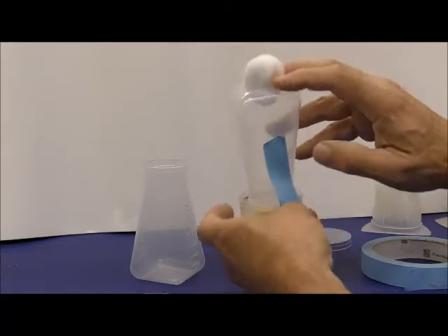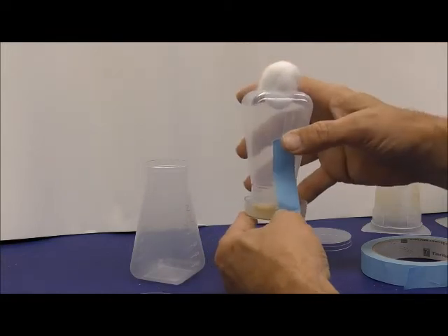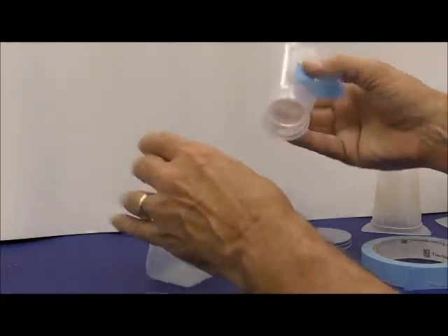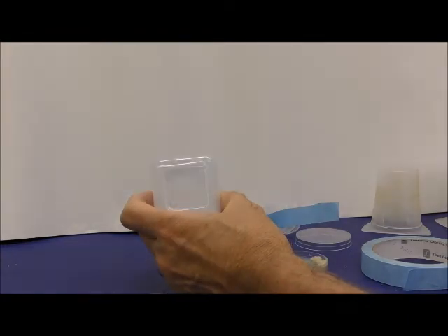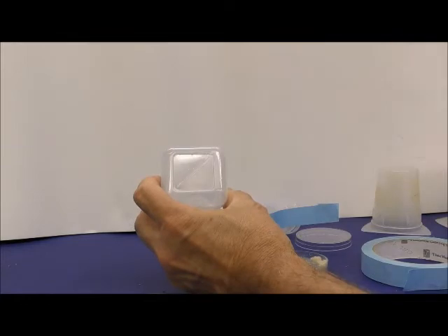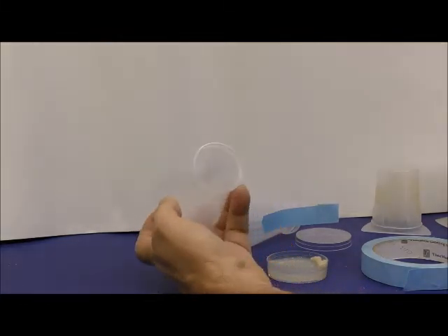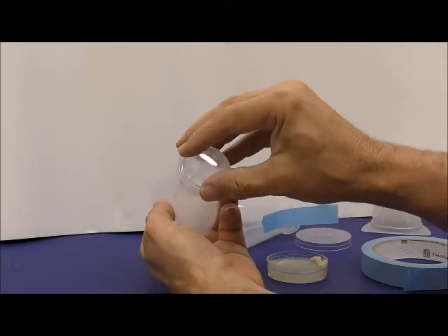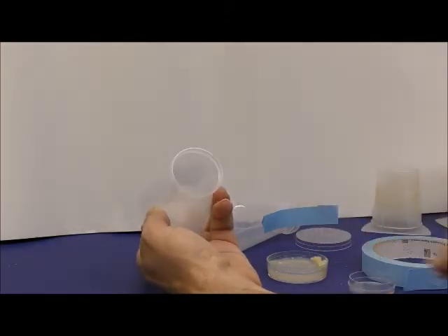The problem is it's pushing on the agar a little bit, and if you push down too hard, the agar will get stuck in there. You might think, oh, well, I'll make the dish on the top and put the cotton plug in here. The problem is many of the plastic bottles have this kind of weird deformation in the bottom, so it's hard to get a little dish on top of those. They do make these smaller Petri dishes that will fit pretty close into there. But you see, like this one, it just fits in tight. It's hard to get it out when you want to change it out.